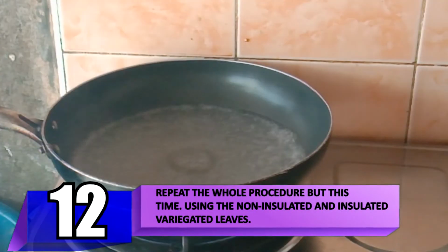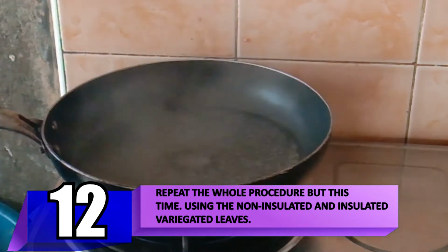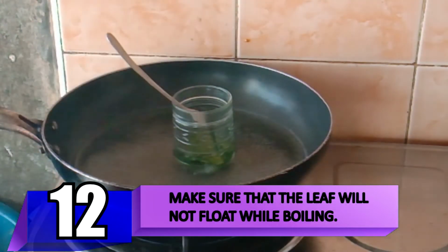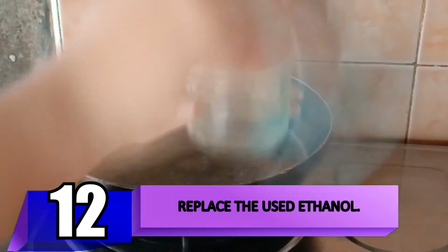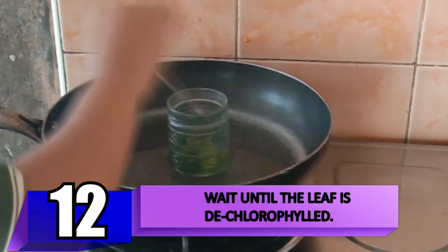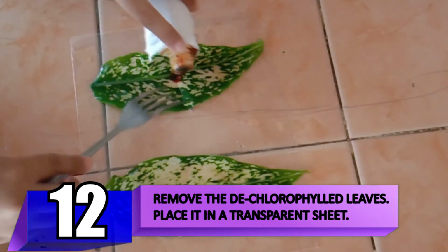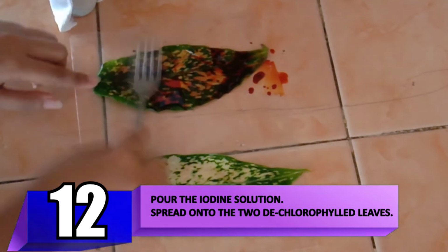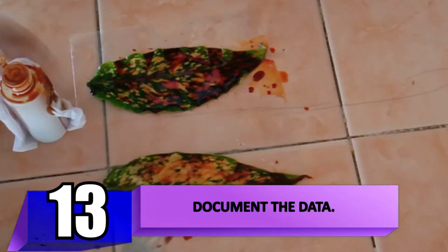Clean the materials and repeat the whole procedure, but this time using the non-insulated and insulated variegated leaves. Document the data.